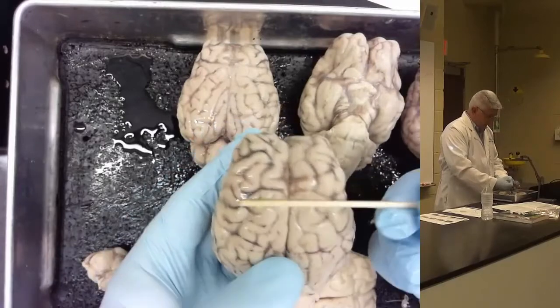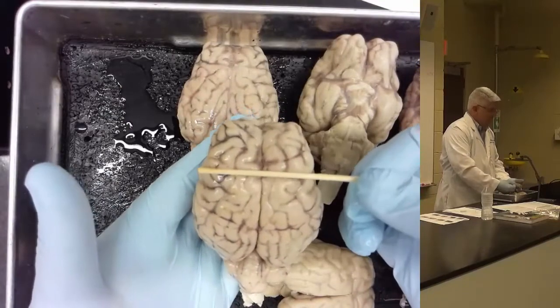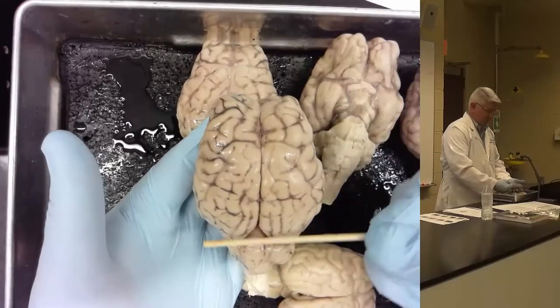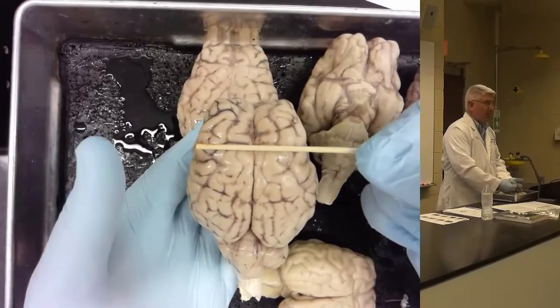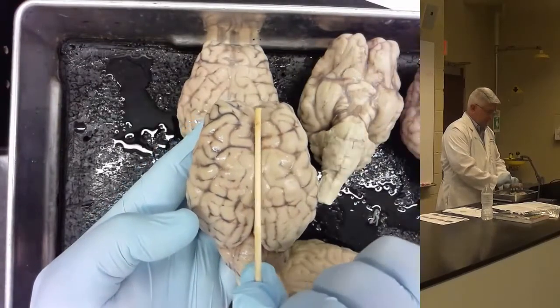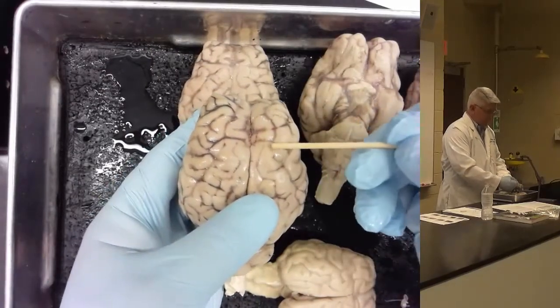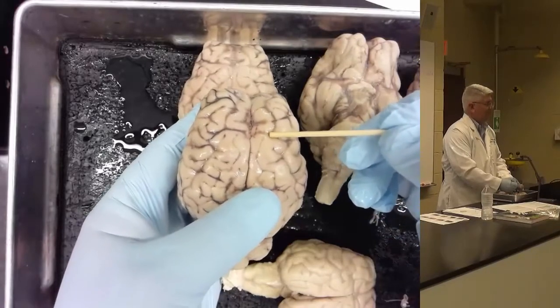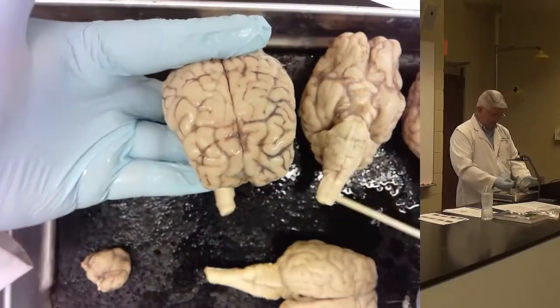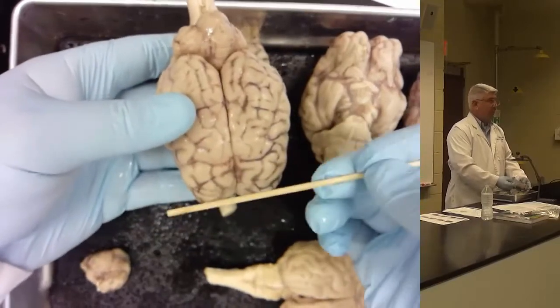Okay, the next thing is looking at the separation of the frontal lobe and the rest of the brain. Like I mentioned, in a sheep brain, this is not centrally located. It's about 1/3 and 2/3 of the brain. That's why we don't call it the central sulcus. It runs perpendicular, makes a T shape with the longitudinal fissure. And so we call that the cruciate sulcus or cruciate fissure. I'm going to turn the brain around this way so we can look at it. Again, we're orientating. The cruciate fissure is in the dorsal anterior part of the brain.